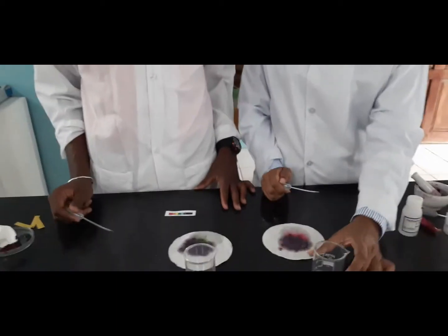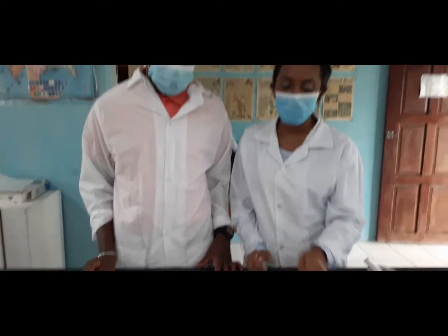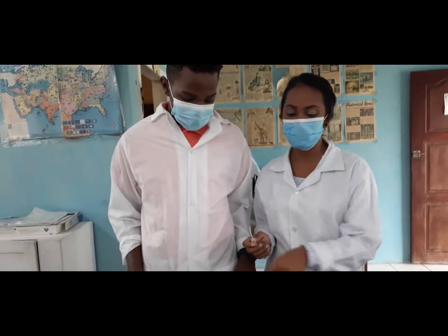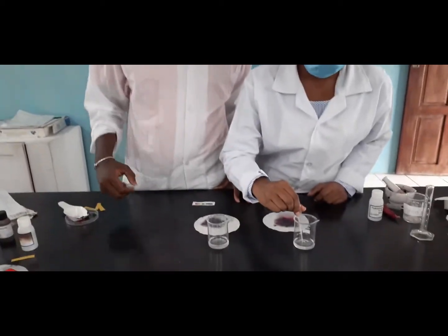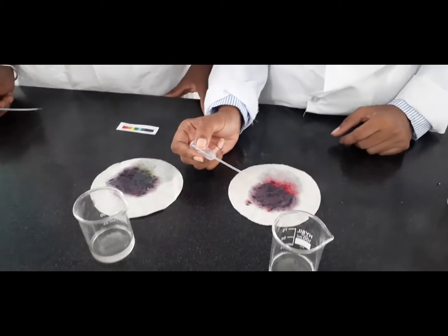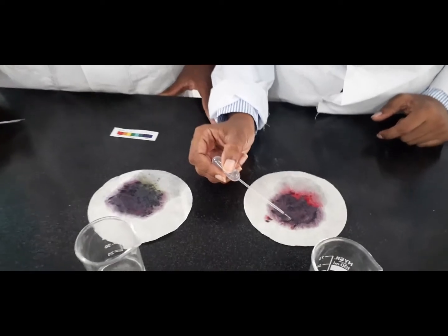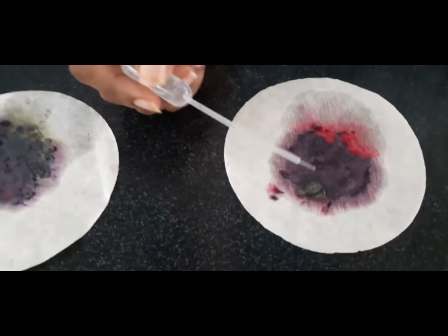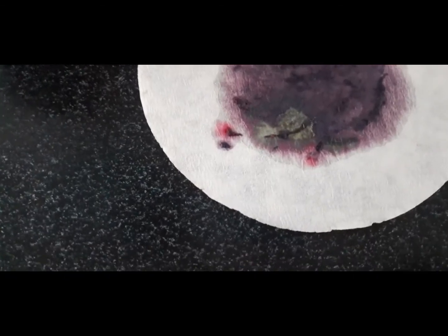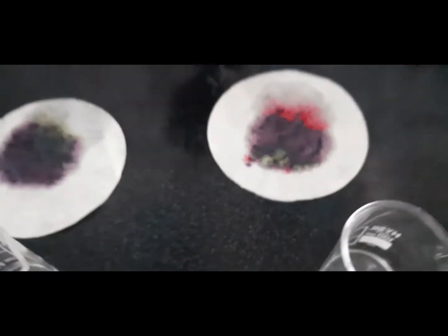So I have here one beaker and another beaker. We name it A and B. I will be testing this one to determine whether it's an acid or base, and Sir Akeem will be doing the other one. First, Miss will go first. So remember, this is our indicator. As you can see, it is turning green. And based on our color chart, once it turns green, it means that this is a base.